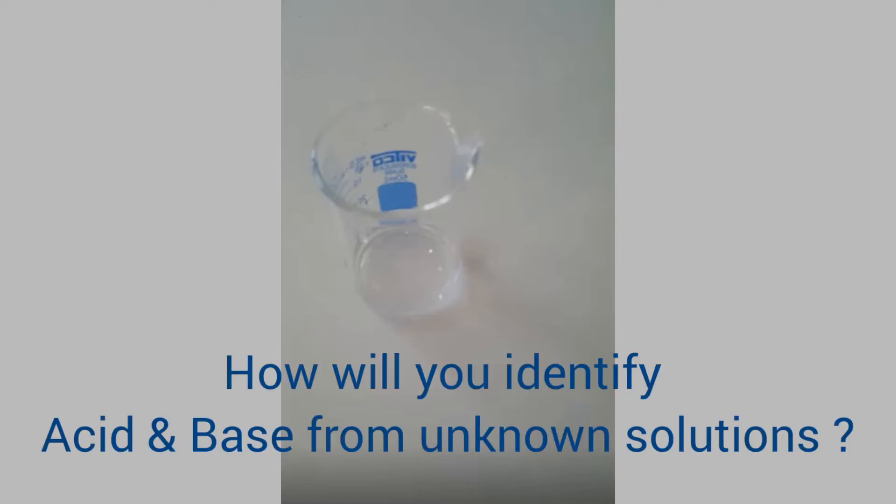The lesson is acids, bases and salt. If you have two unknown solutions in your hand and you are asked to identify which one is base and which one is acid, how will you proceed the test?